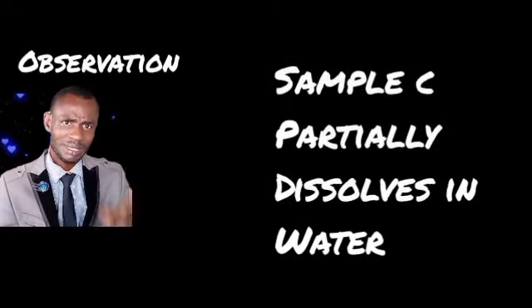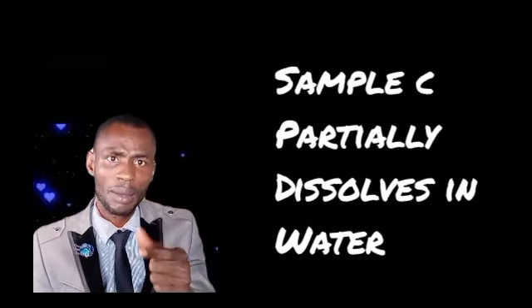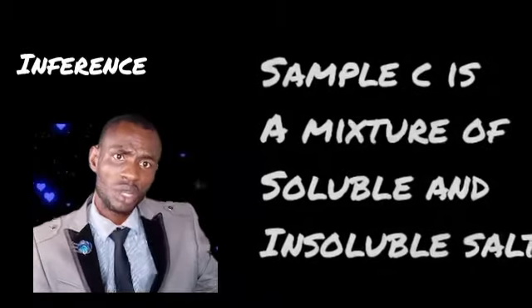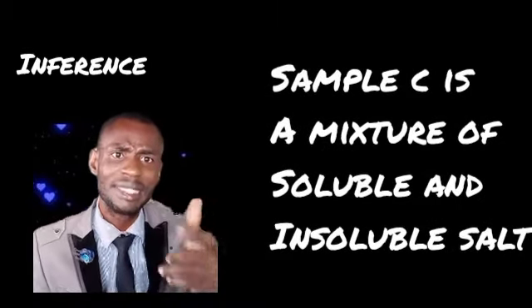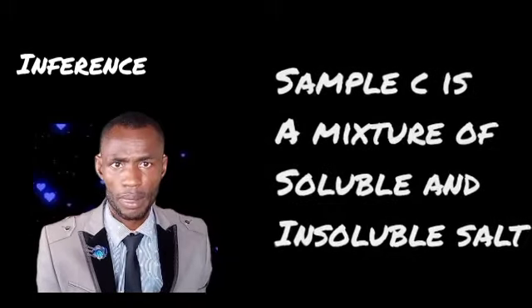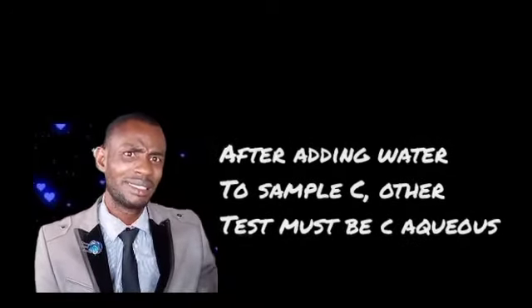Okay, your observation should be C partially dissolves in water. That's the observation. That's what you observe. Now your inference will be C is a mixture of soluble and insoluble salts.